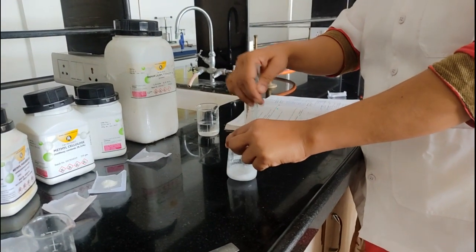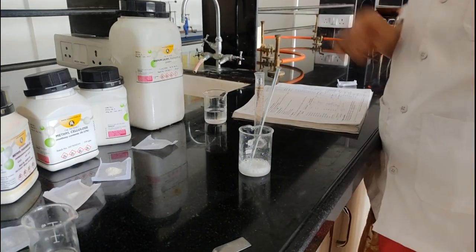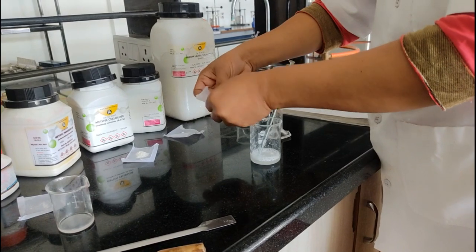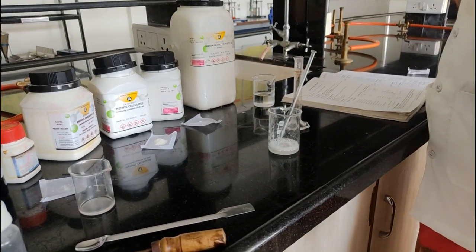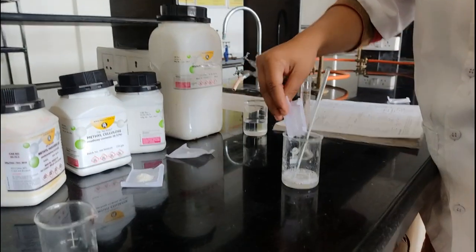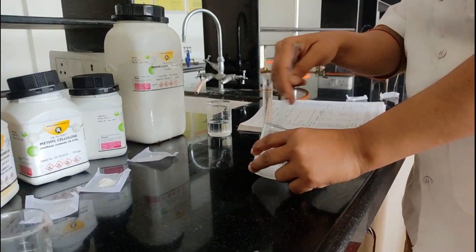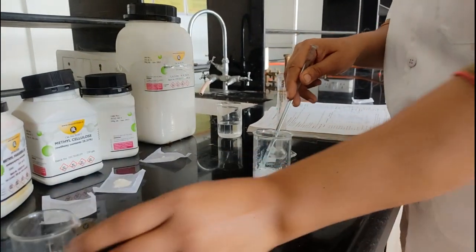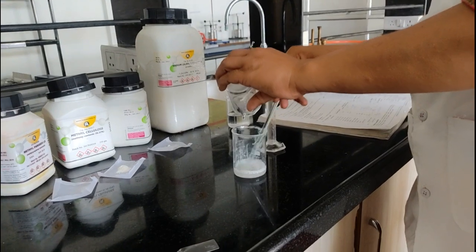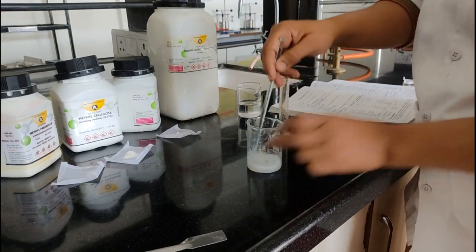Our sodium lauryl sulfate is now dissolved. Then we add methylparaben and propylparaben. Methylparaben and propylparaben are used as preservatives. Then we add the major quantity — 0.5 gram of glycerin into our shampoo. Glycerin is added to prevent the dryness of the formulation and is used here as a conditioning agent, giving a conditioning effect to the hair.